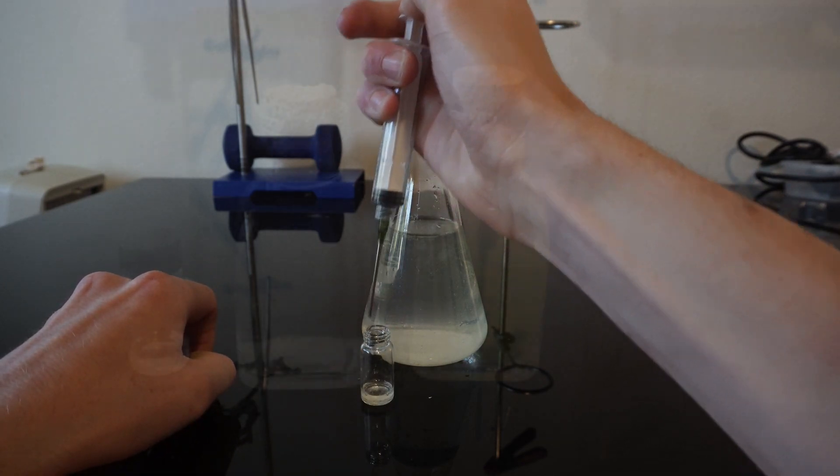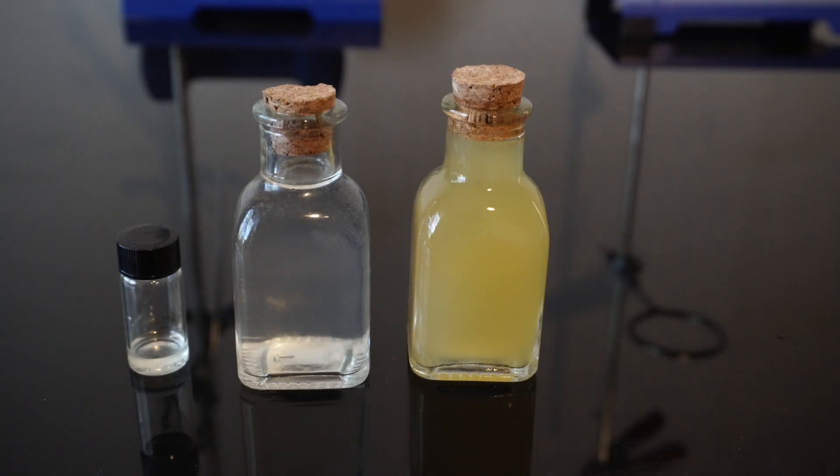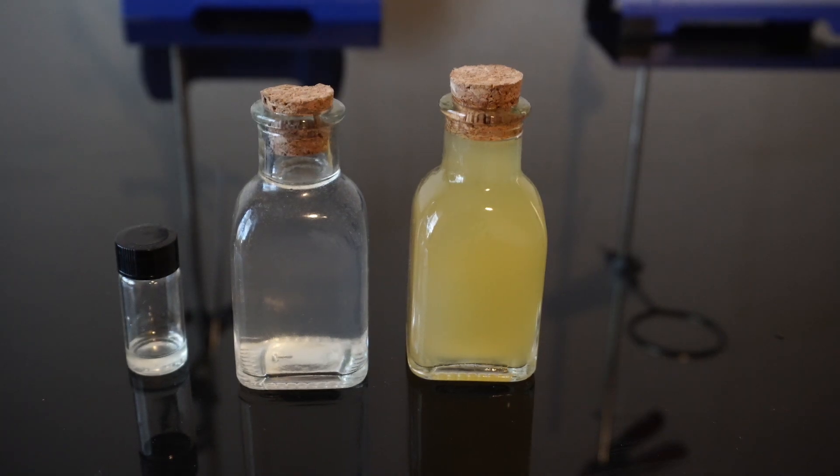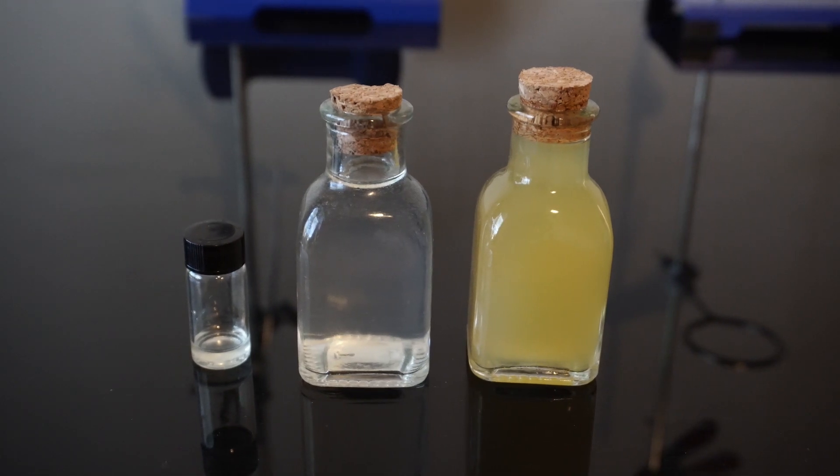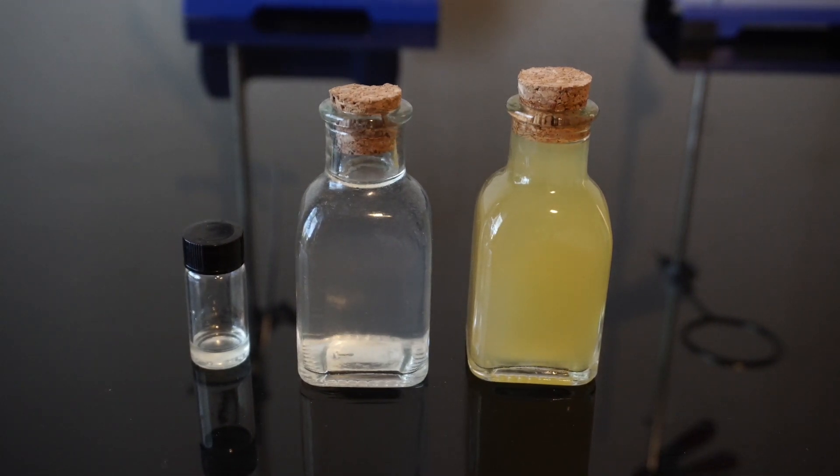We can see the stages that we just went through here from right to left. We can see our hydrosol in our boiling flask, our hydrosol in our receiving flask, followed by the limonene in our 10ml dram.